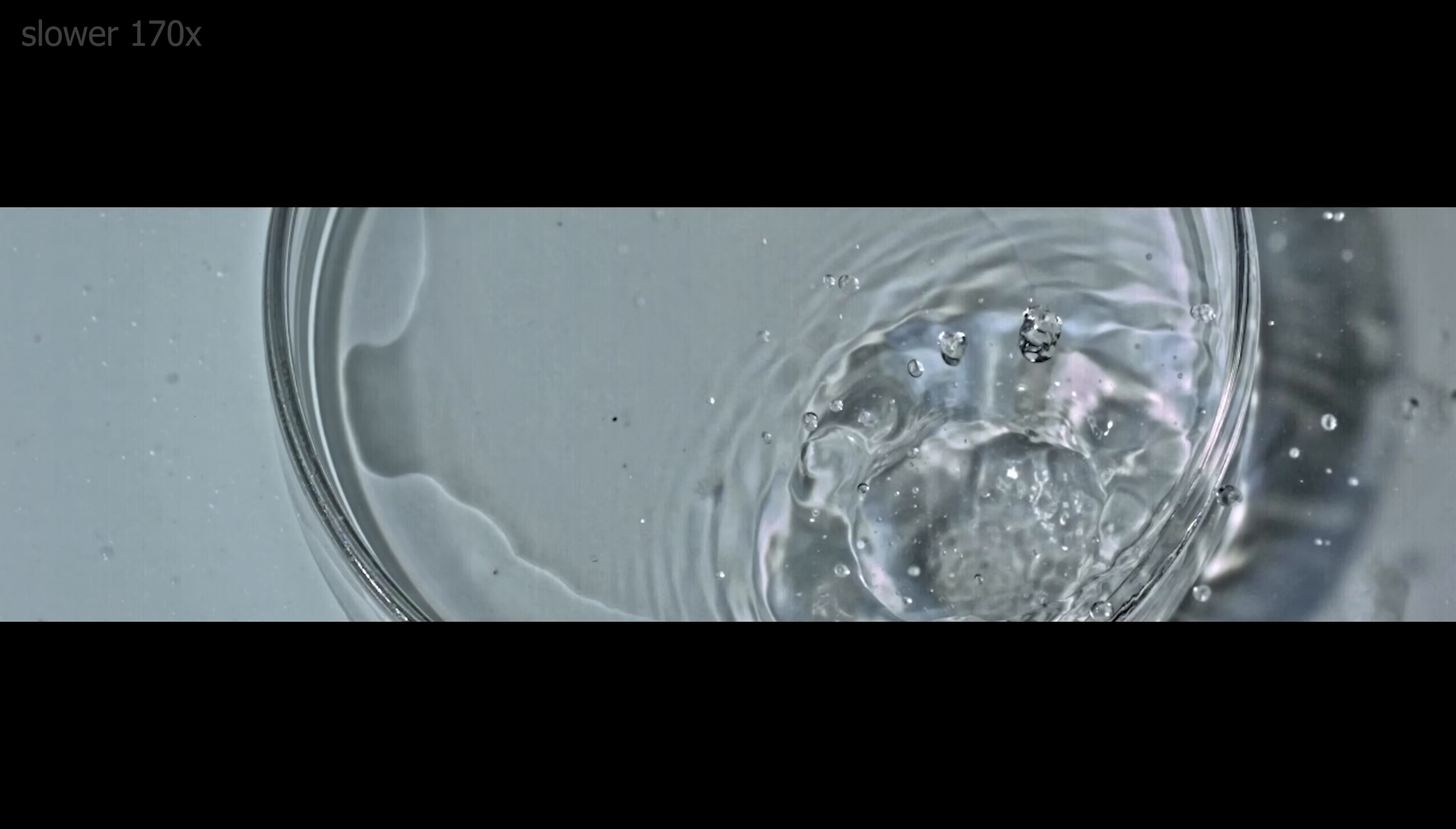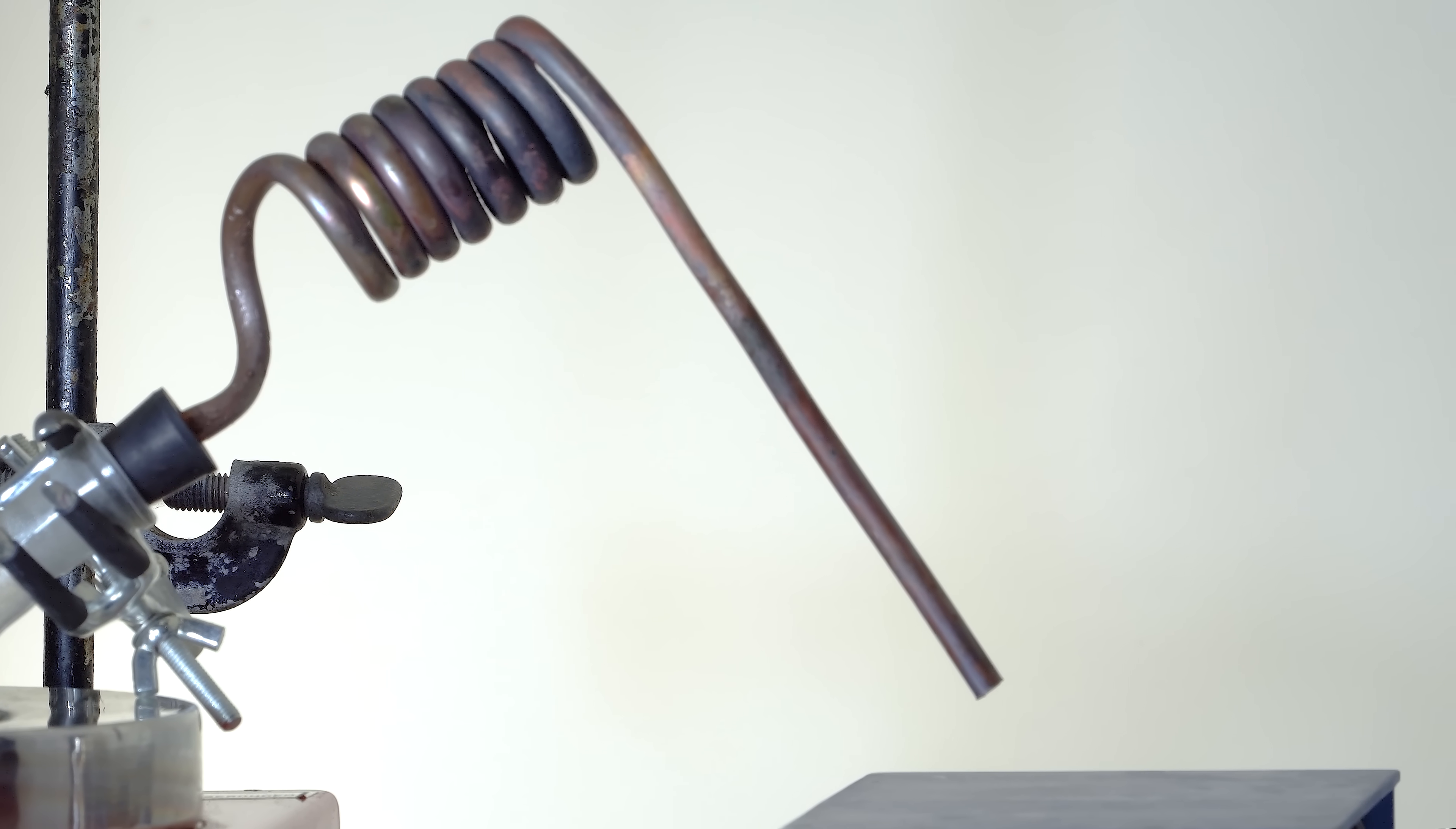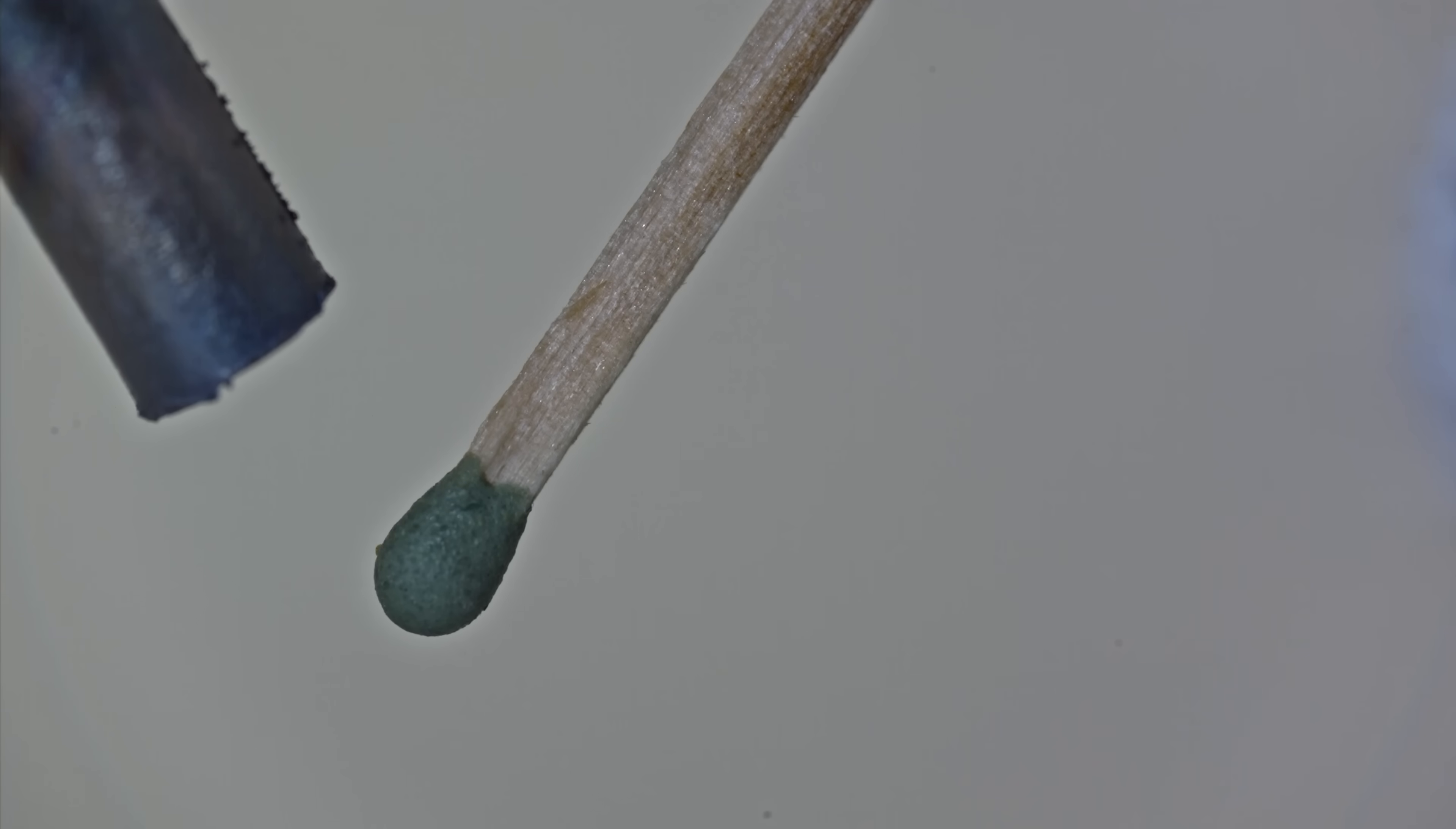Moreover, the blue color of solvated electrons can be observed when the sodium-potassium alloy interacts with superheated steam. I have boiling water in a flask connected to a helical copper tube heated by an external gas burner. The steam passing through the coil reaches a high temperature, allowing it to ignite a match. Yes, I managed to light a match with water.